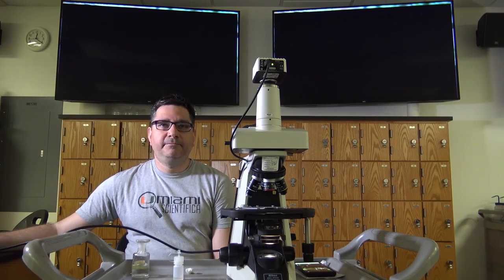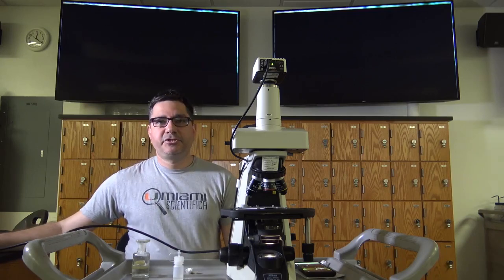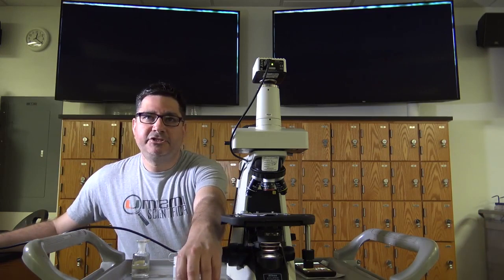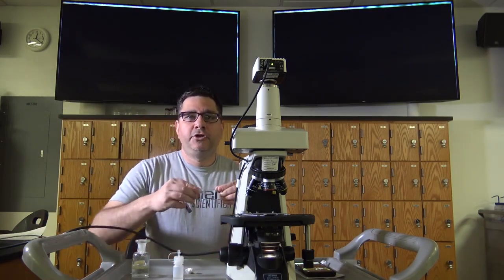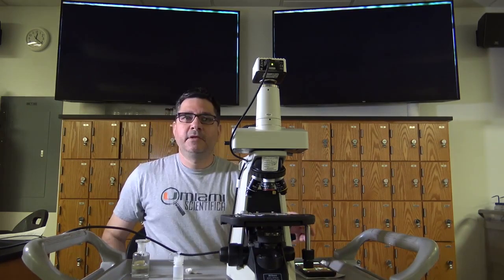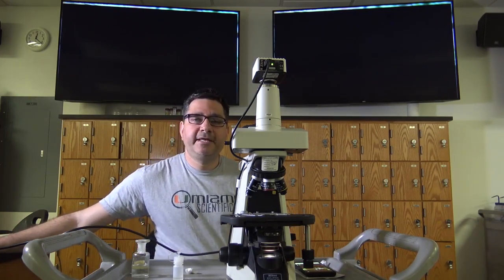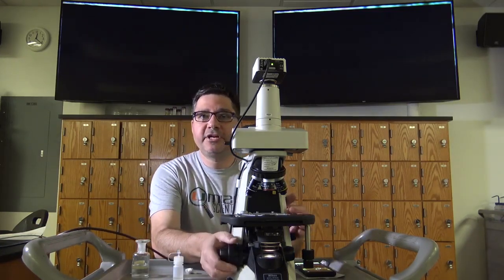Plug in your microscope. After making sure that your microscope is on the 4x objective, drop the stage to the lowest position using the coarse adjustment knob. Load your slide onto the stage of the microscope with the specimen facing up. Turn on the power to your microscope. While looking through the eyepieces, try to keep both eyes open and rotate the coarse adjustment knob.